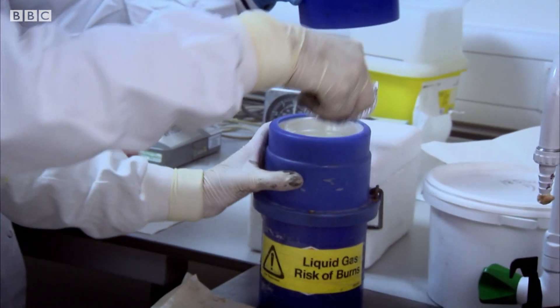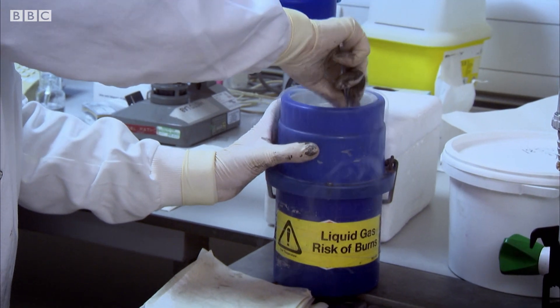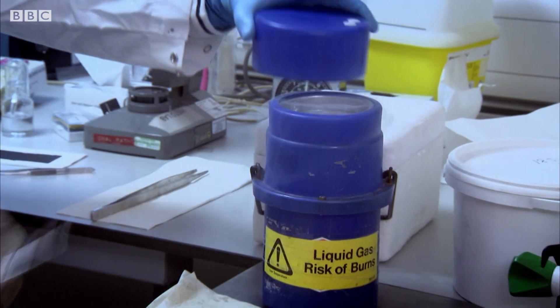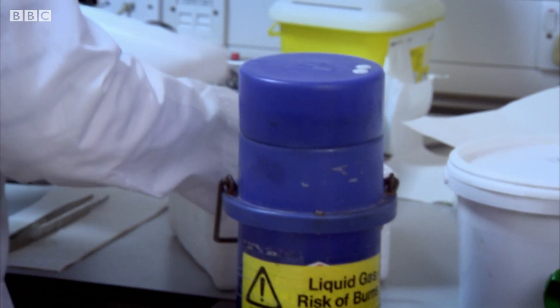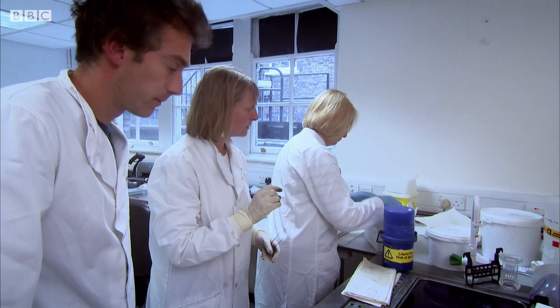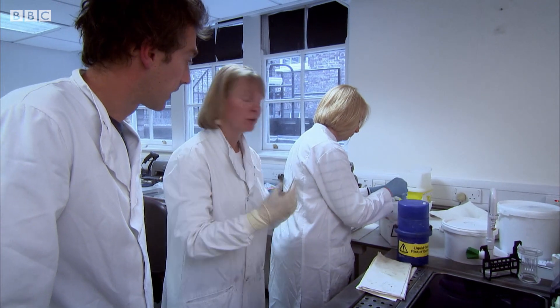The tissue is immersed into liquid nitrogen, which instantly freezes the samples. Sally then transfers those pieces of tissue into small tubes, allowing each piece to be banked separately for long-term storage.